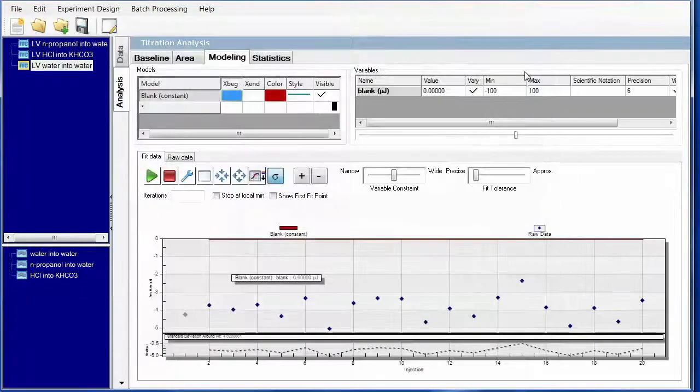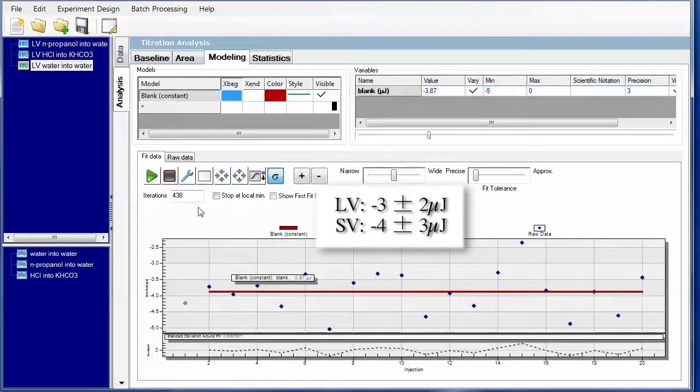So we're going to load the model, but we're going to apply a little bit of smart fitting, meaning we saw all of the data, it was all exothermic. And we can also look on our baseline and see that the minimum value on the y-axis is around -5. So we'll change everything to exothermic with a minimum -5 and change our precision to 3, which will enable us to fit the data a little bit more quickly. So this I would consider a good fit for the water titration.